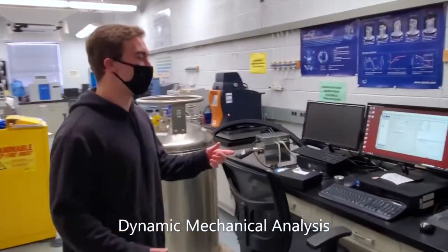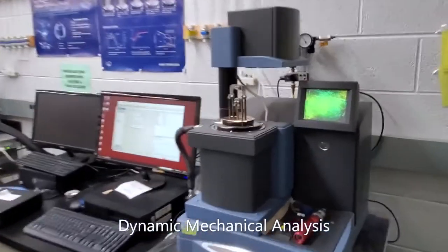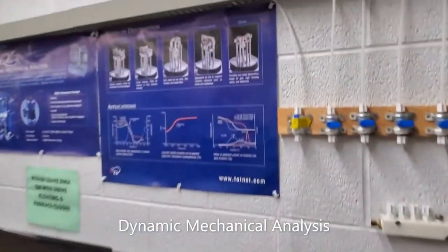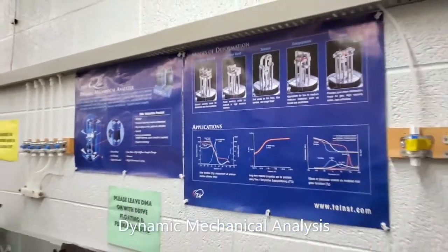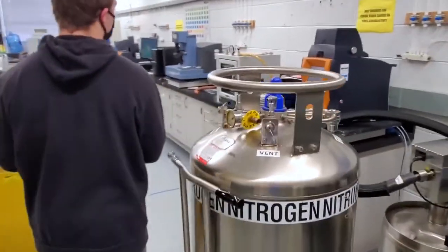So the first thing we have here is the DMA, which stands for Dynamic Mechanical Analysis. This is typically for the characterization of mechanical properties of, mainly in this case, polymers, just because it's on a smaller scale. And as you can see on this chart, we do different types of mechanical testing: 3-point bend test, tension, compression, shearing.